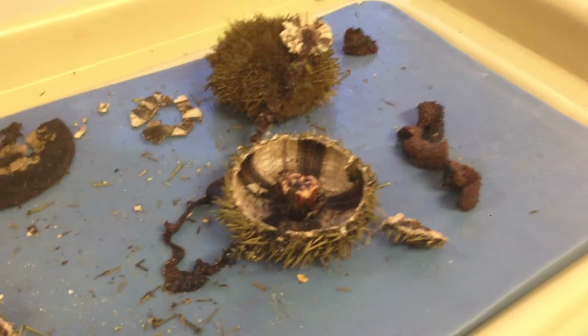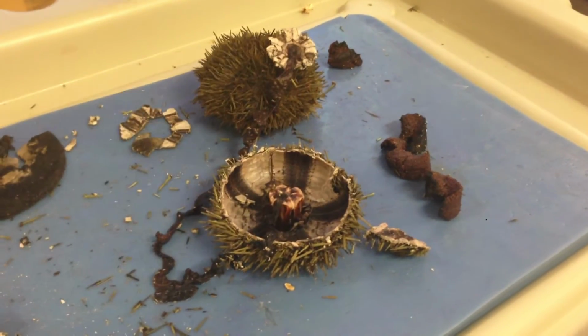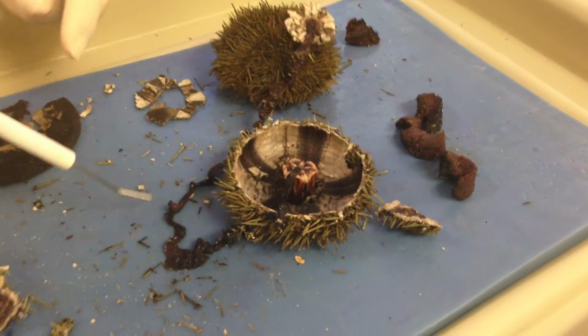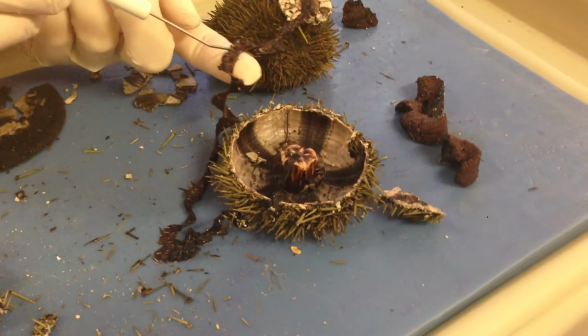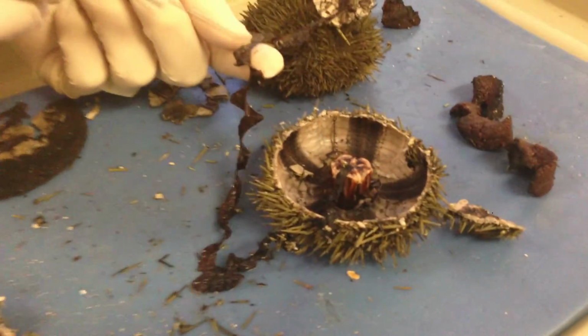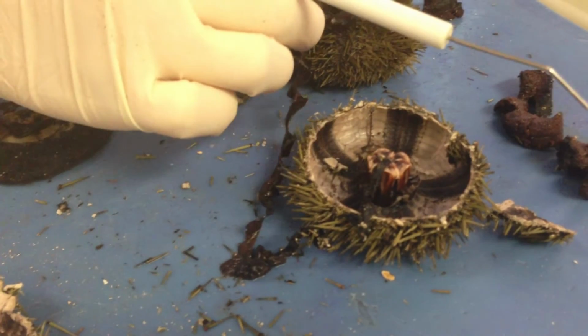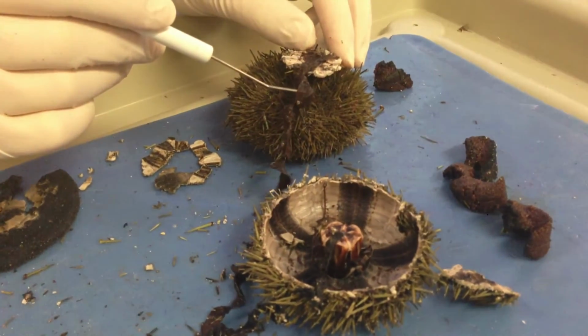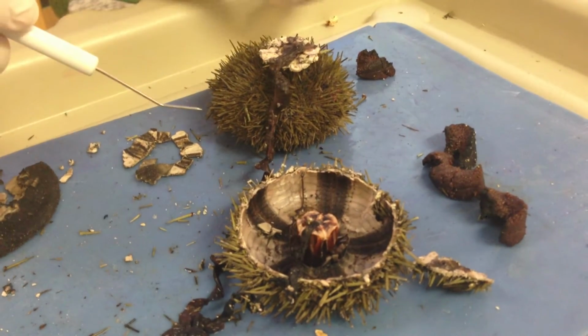Then what I did was, you can look at the siphon of the intestine, which is located next to the intestinal tract. If you look closely on the edge of the intestinal tract, there's going to be a little siphon. Sorry, it falls off. Okay, it's this little siphon right here. It runs right along the edge. You would have seen that in your pictures.